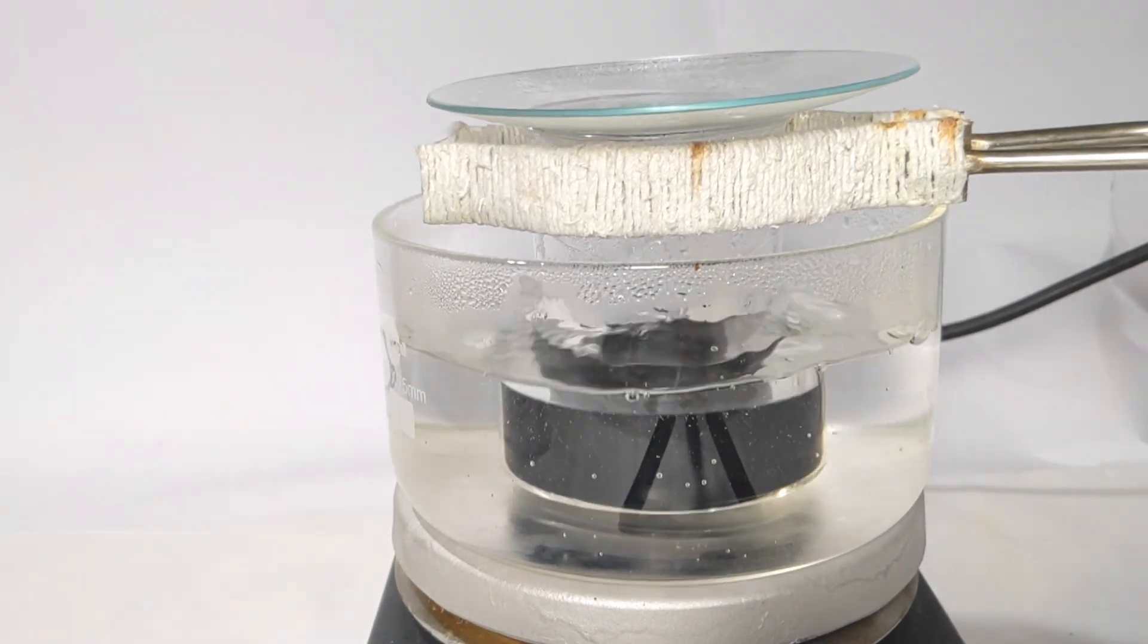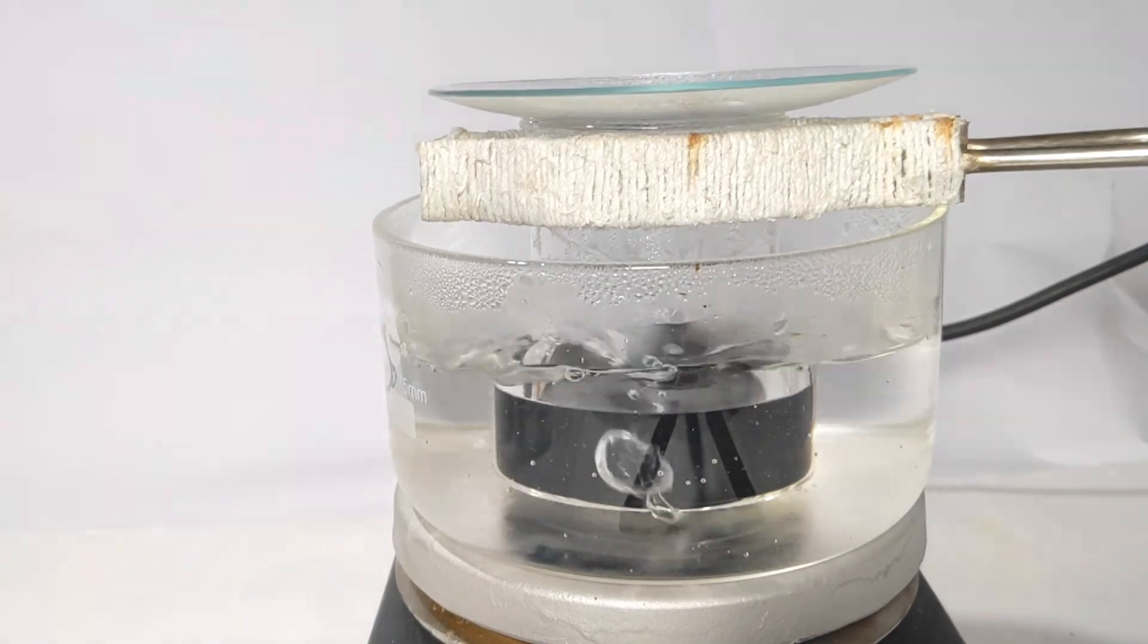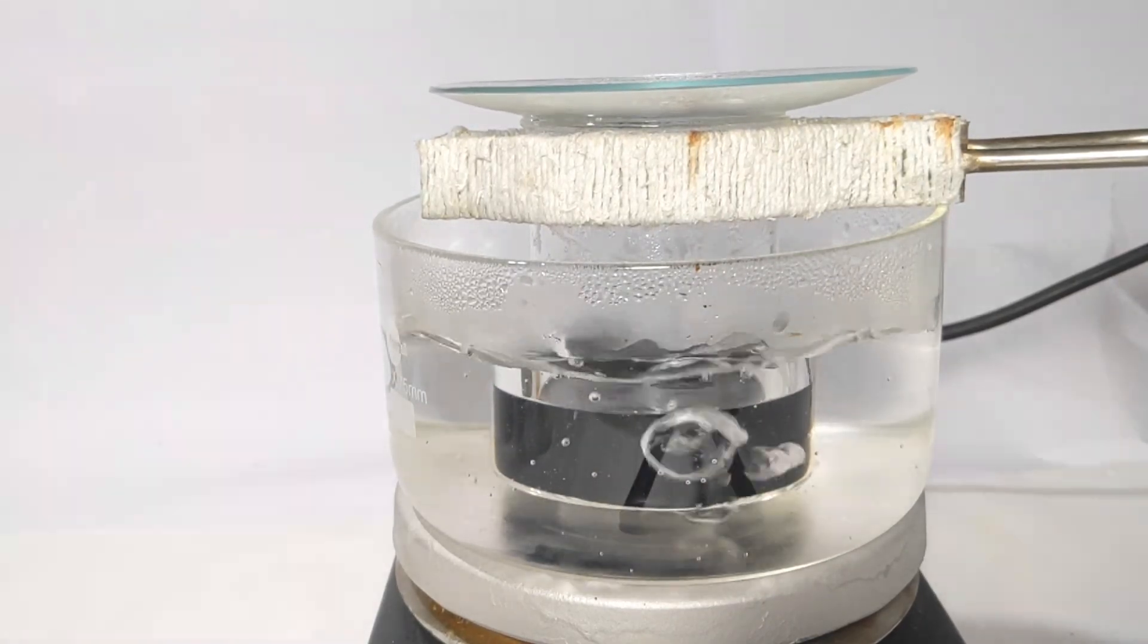Next, the beaker was placed in a boiling water bath for 90 minutes. A watch glass was placed above the beaker to prevent evaporation of water.